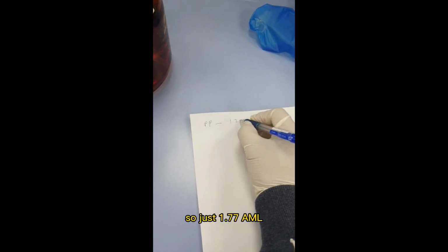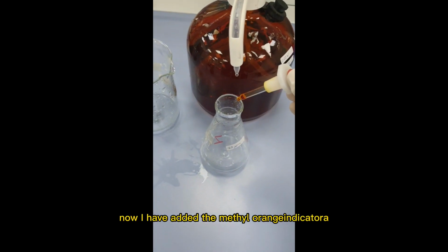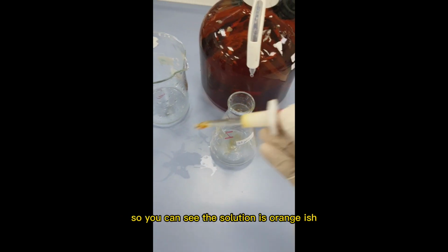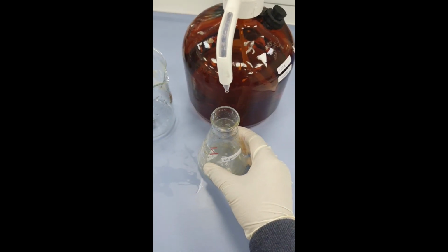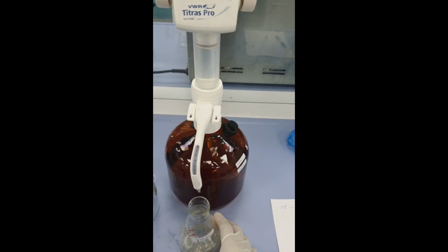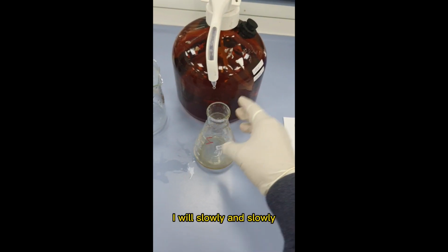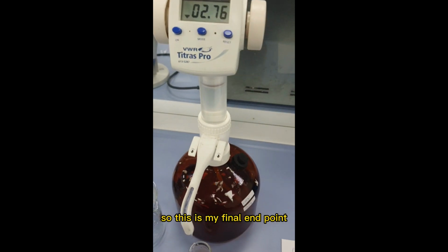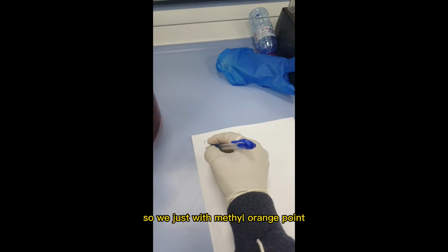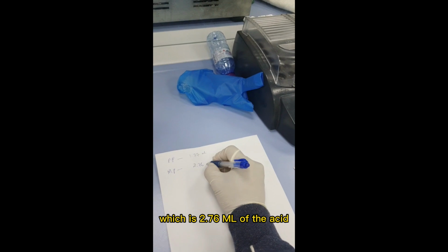It's 1.77 ml. Now to the same sample I would add the methyl orange indicator. Now I have added methyl orange indicator. You can see the solution is orangish. Now I will titrate till I get that point. I will set again, slowly and slowly. So this is my final endpoint, which is the methyl orange point, which is 2.76 ml of the acid.